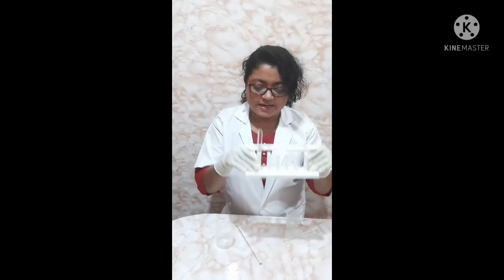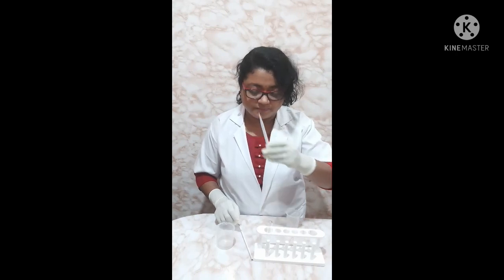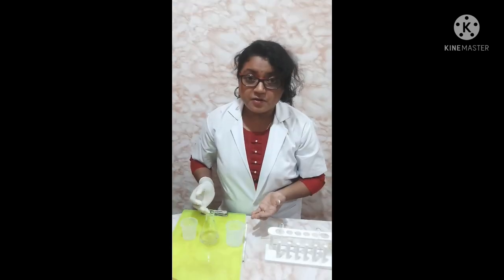Welcome to my lab. Here we have a test tube with a test tube stand, a glass rod, a dropper, a conical flask, a 50 ml beaker, and a 100 ml beaker.